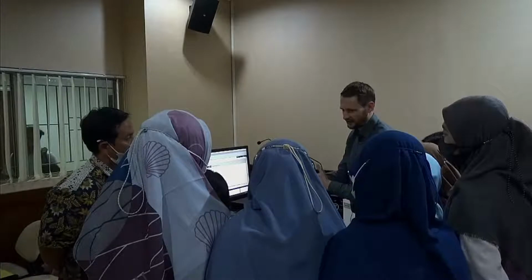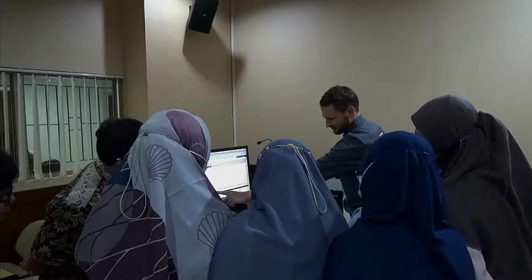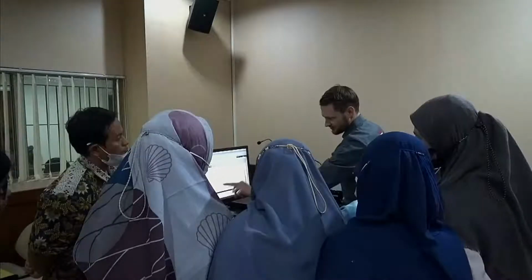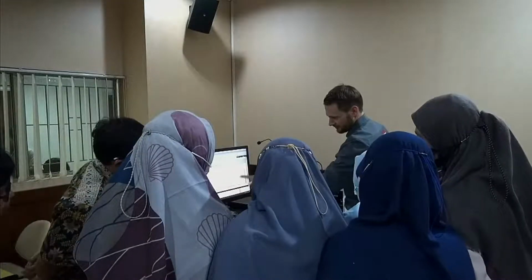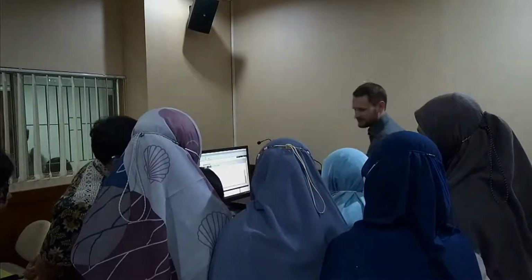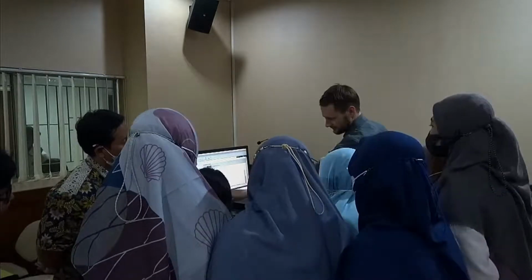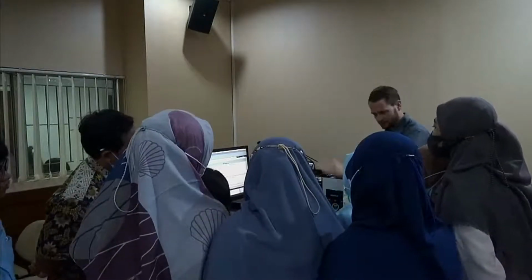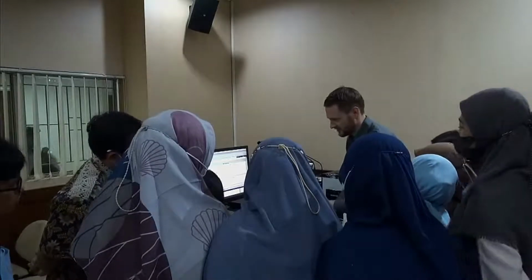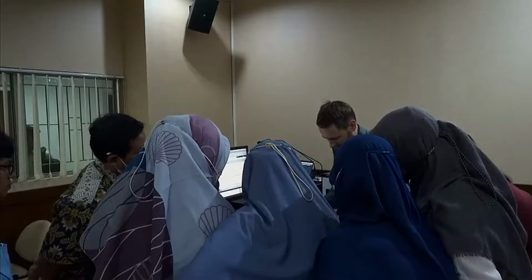It is aligned. Now we have a dark measurement, no laser, just flat signals. We just measure electrical noise. And the next step is we switch the laser on and measure our background. There you see the first channel is always a little higher because it's right next to the main beam, so it always catches a little bit of stray light. So to get this completely dark is physically not possible. But that's why we take the background to actually deduct it from our measurement. So now we can add some sample.